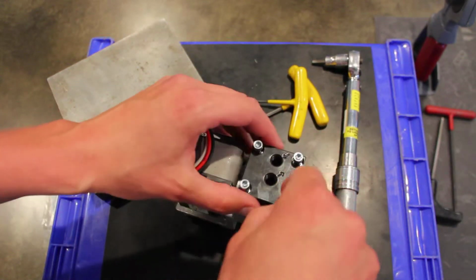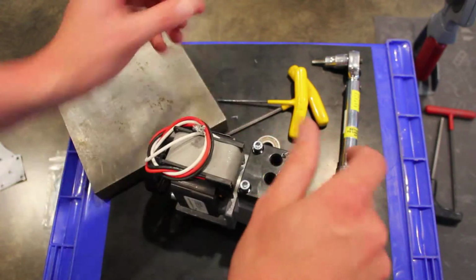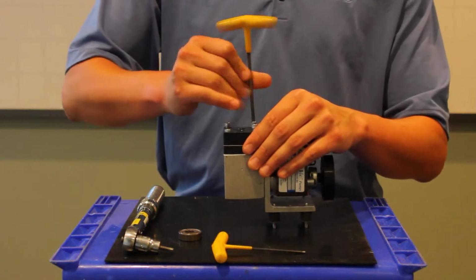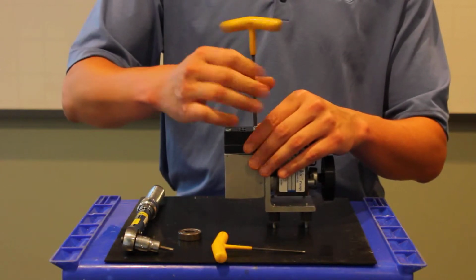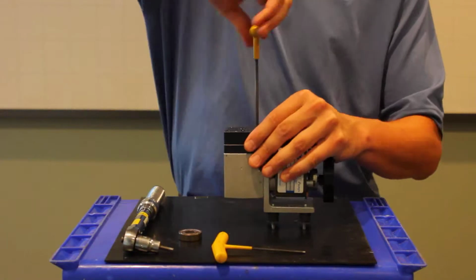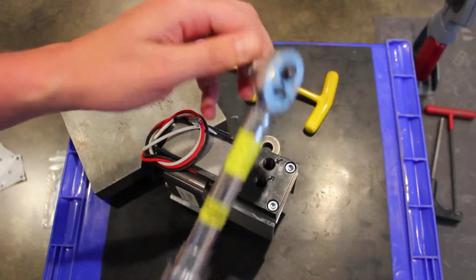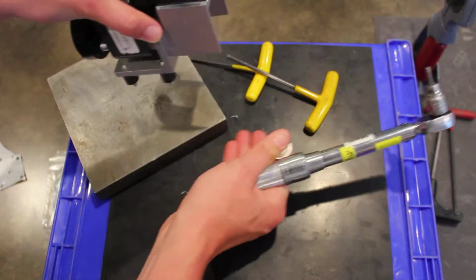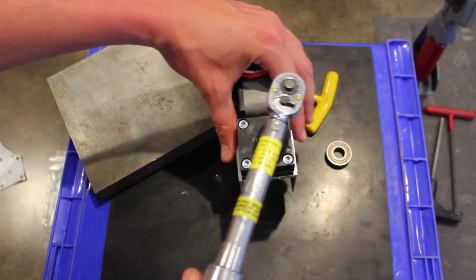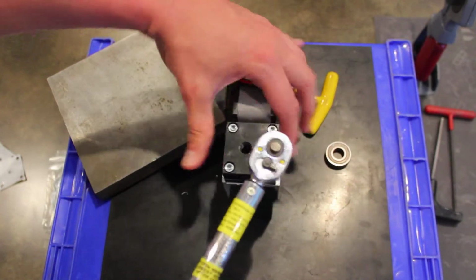So we'll place that directly on top, get these screws just kind of threaded a couple of times. Nice and good. And then we take our 5/32 Allen key, and I like to just get these started so I know that my gasket's not shifting anywhere. Now we've got everything on there nice and tight, and then lastly we're going to take our torque wrench set to 28 inch-pounds, and we're going to just make sure that we're nice and tight on our 4 head bolts. And that'll prevent the pump from leaking, and it'll also make sure you get a good seal and good performance.